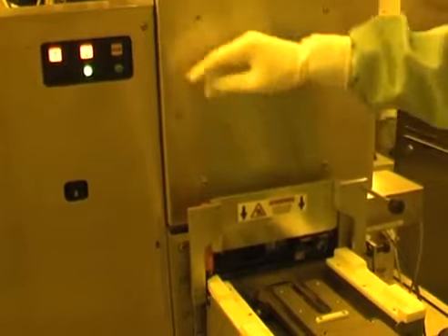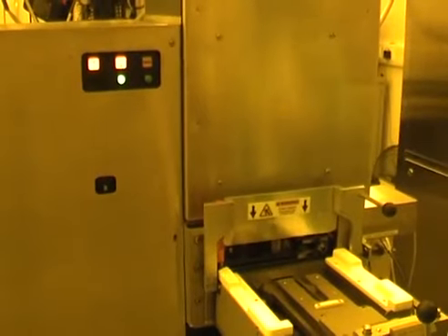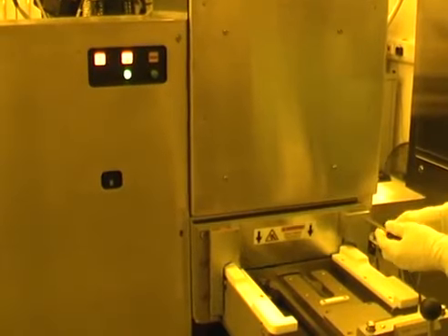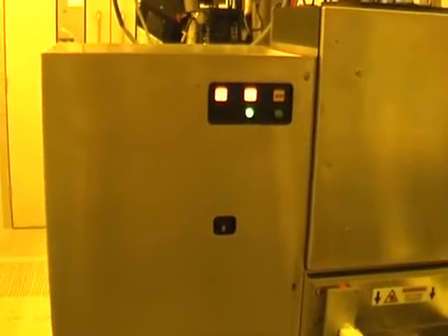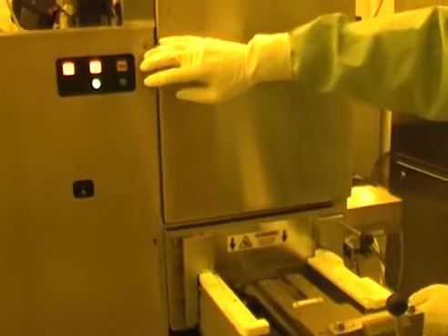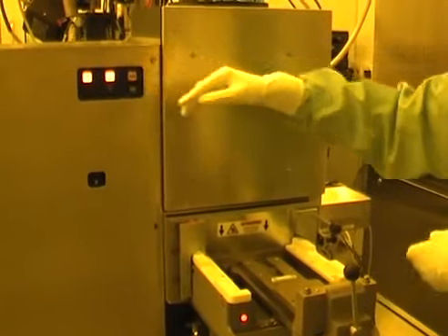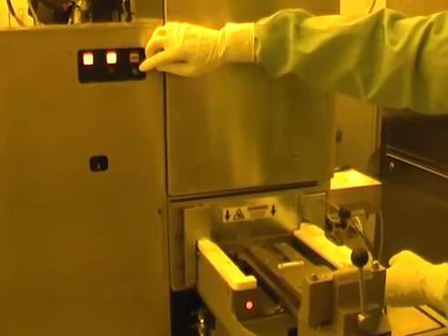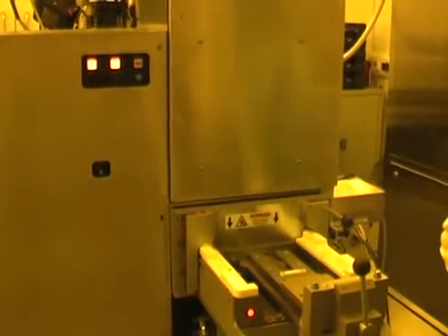This outer door and these 2 green buttons are a safety device to prevent operators from losing their fingers. So to close the inner door, we close the outer door first, which helps the safety. We press the door button, but this doesn't yet close the door. I have to press both this green button here and this green button up here simultaneously, and that then closes the door. And the idea is that if I've got both hands stretched out apart from each other, I won't have my hands inside the door when it closes and cut my fingers off.